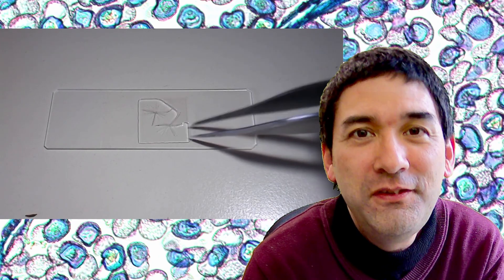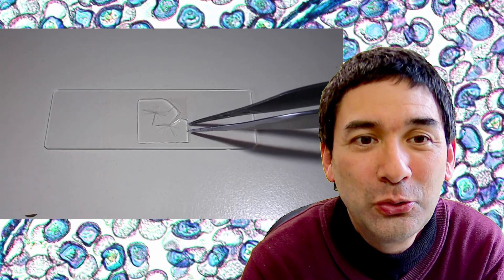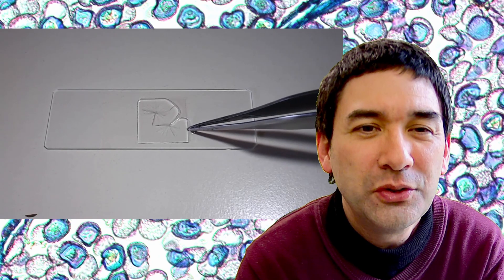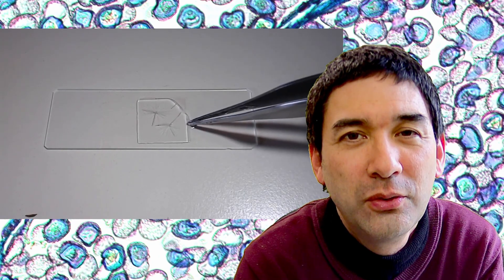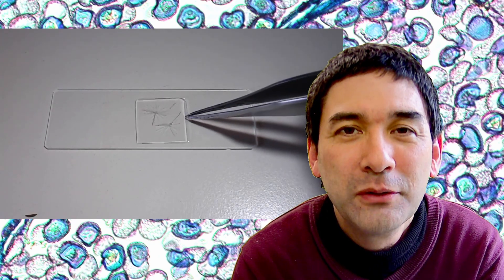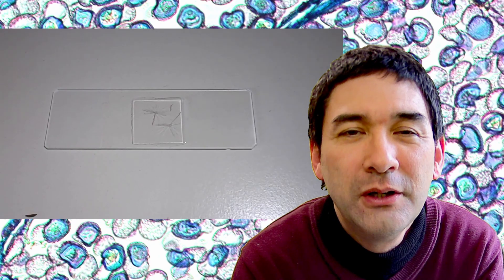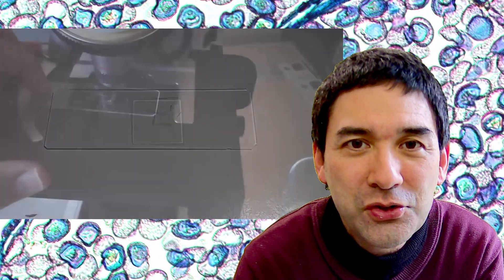Don't keep the viewer waiting. Even for me, this video is a bit too long to watch. Keep it short—it's not necessary. Also, it's not necessary to fill it completely with water, because the important part was already surrounded. Now we can finally put it under the microscope. Here it is.